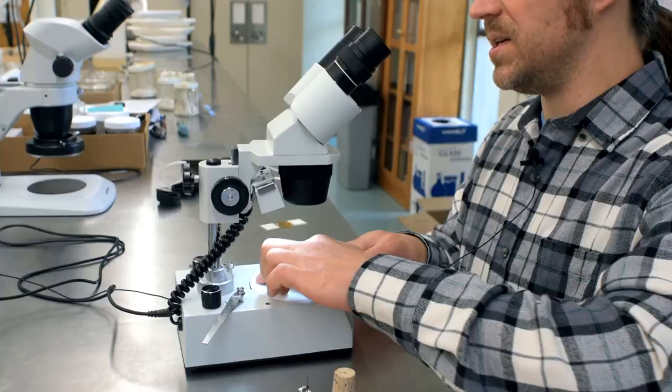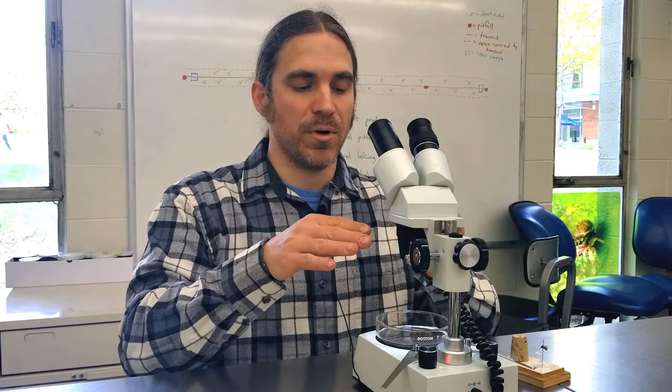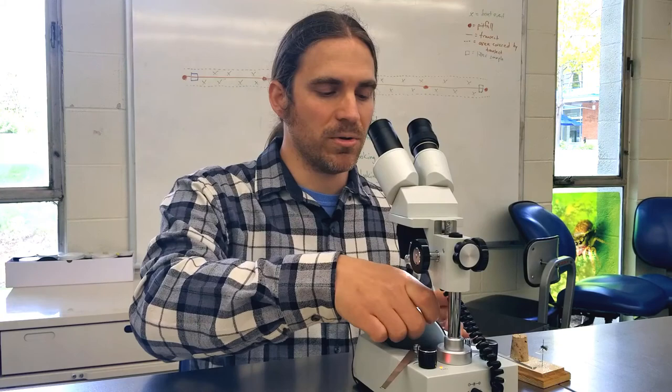Depending on the specimen you're looking at, you can adjust the base color — it's either white, or you can pull it up, flip it over, and it's black. When sorting samples in alcohol, I often find it's easier to have a black base so you have a nice dark background. However, when looking at a pinned insect specimen on the scope, especially if you move it off the stage, it's often easier to have a white background.